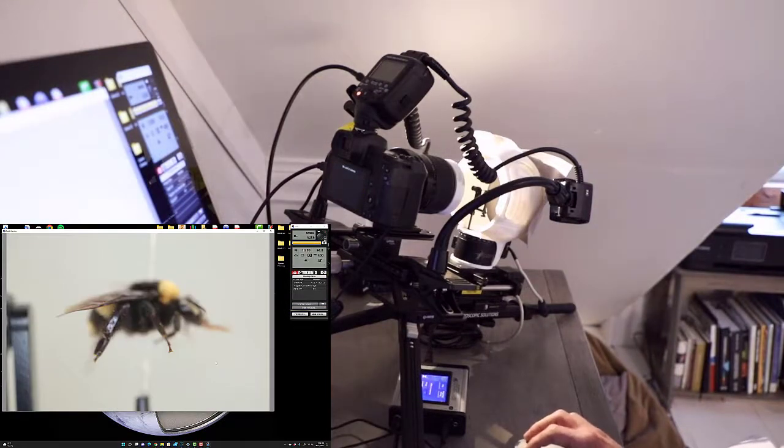Okay, so already you can see what we're going to be up against. You can see here that the hind leg is extremely reflective. It's reflecting a lot of what's coming off the front of the diffuser. Now, just want to emphasize, it's not necessarily a bad thing that the diffuser is being reflected off of the specimen. That, in essence, is showing that that specimen is reflective in those areas. Without it, it might be a characteristic that's either missed or overlooked.